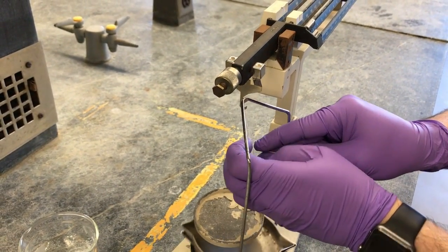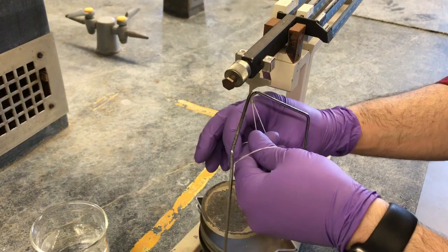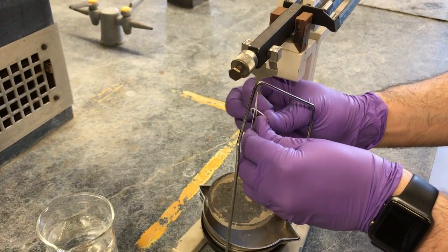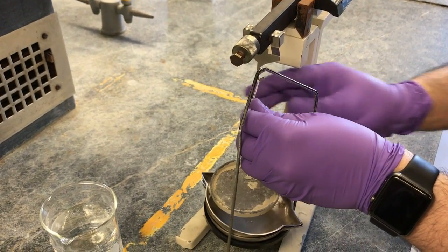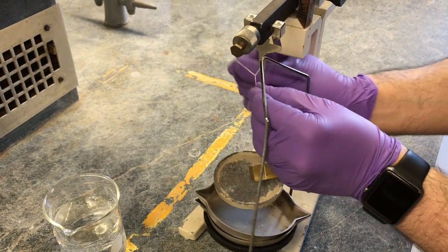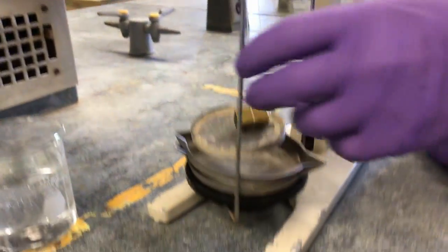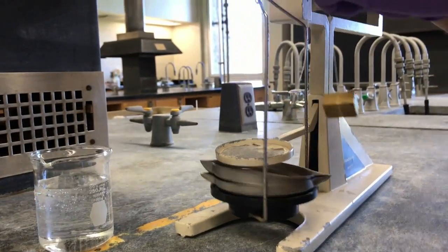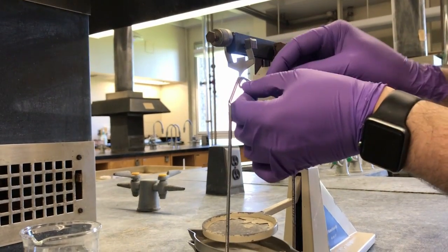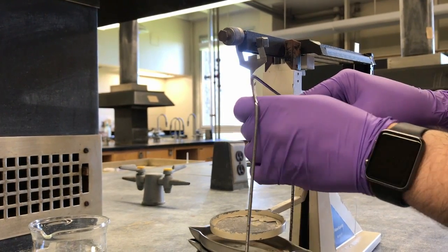So it might take you a couple tries. A little difficult, but just stay calm and don't try to rush it. So let's see. No, see, it's touching the bottom. You can loop it. Never mind, you got it. So anyway, for those watching, you can skip ahead.